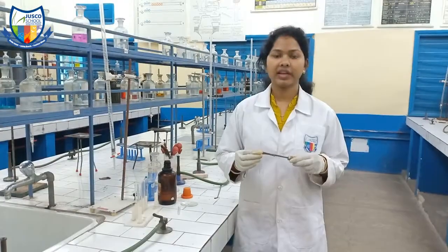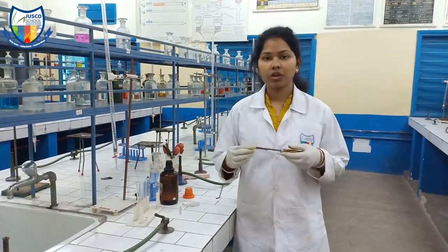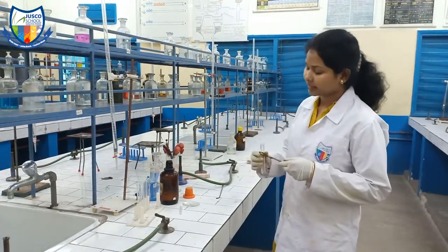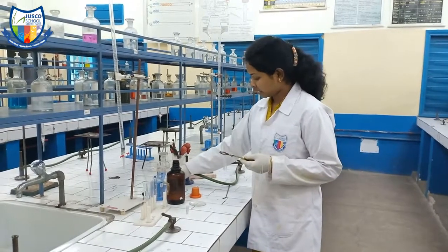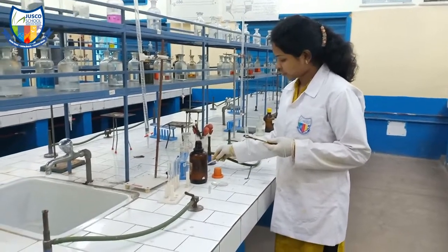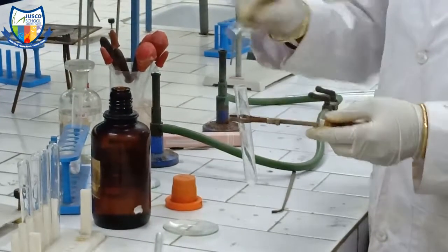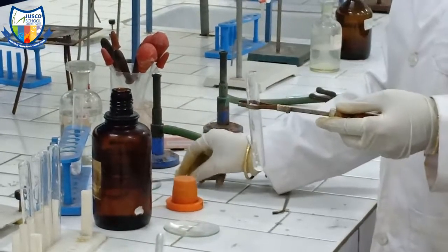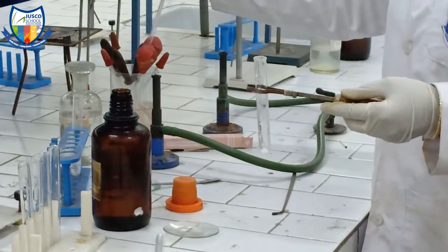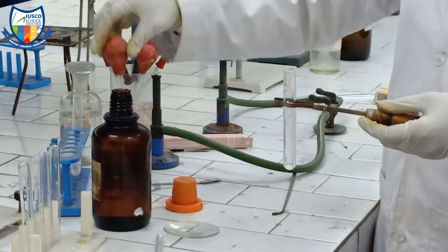Now let us start the test for acidic radicals. For our first experiment, we will take a pinch of salt in a clean test tube and add a few drops of H₂SO₄.